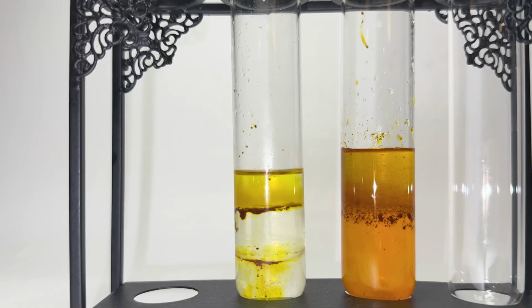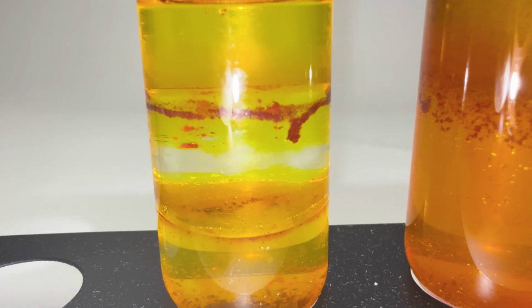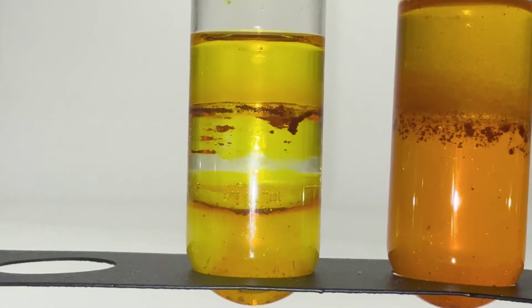At the interface between the aqueous and organic layers, you can see the undissolved bits of the drug. But you can see that when it actually touches the aqueous solutions, it dissolves, evident by the change from the solid red color to the dissolved yellow color.